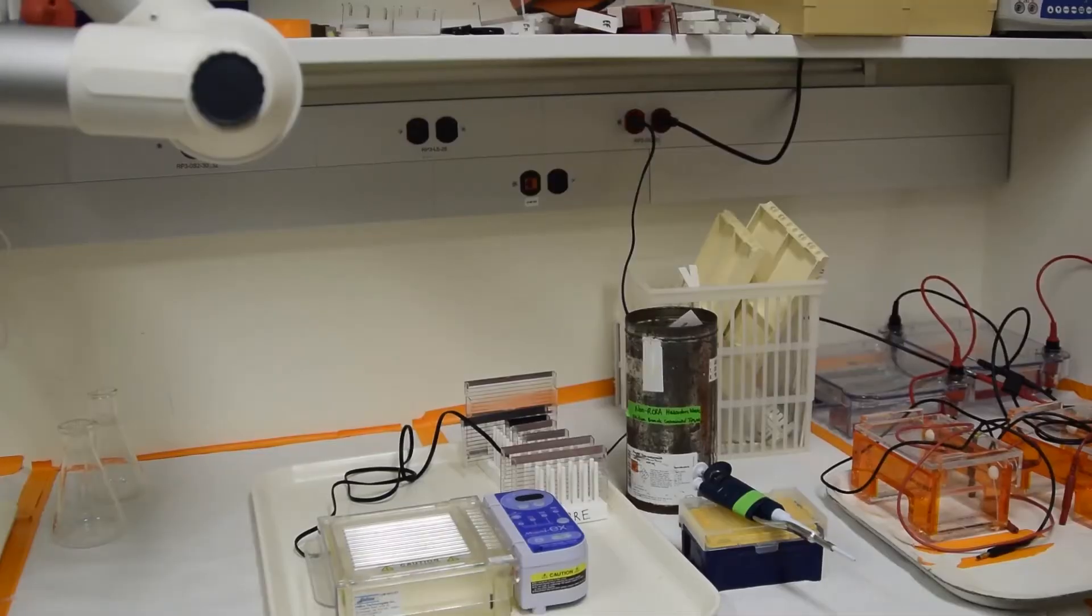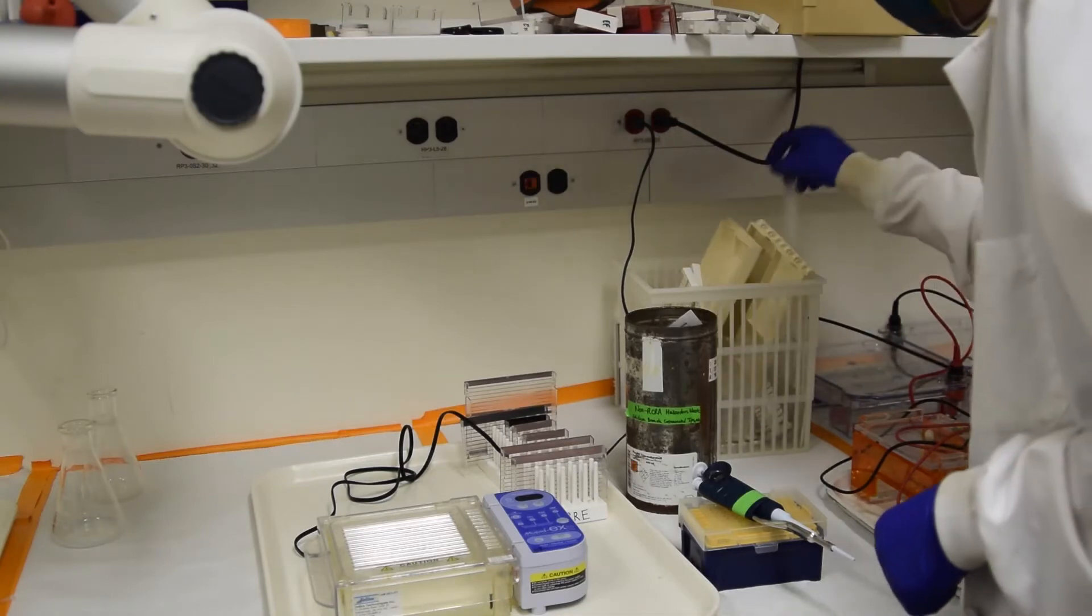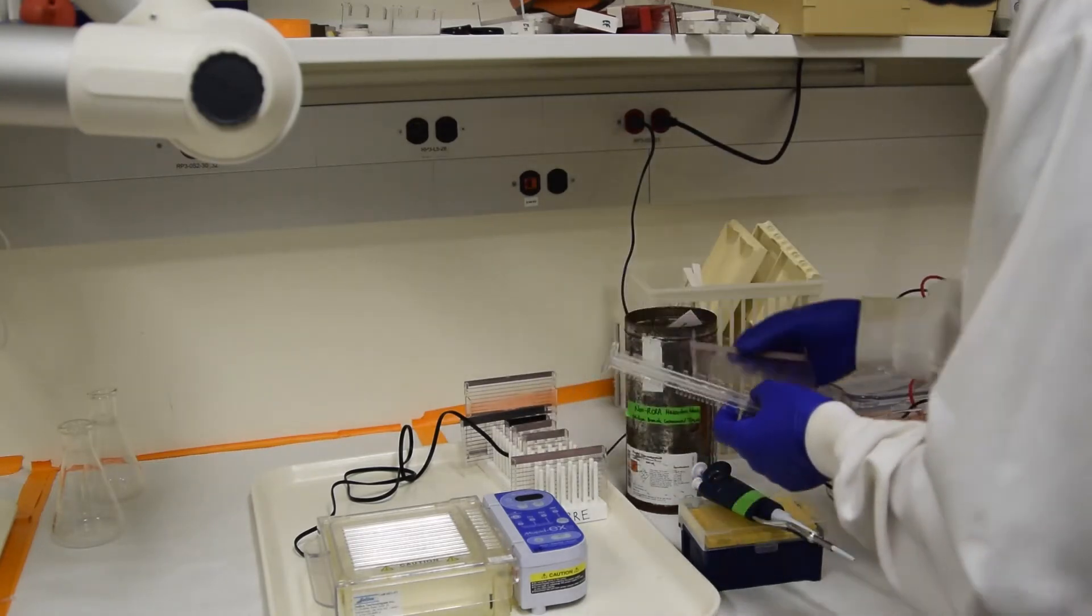Get out an appropriately sized gel tray. You can borrow them from other labs as long as you keep them in good shape. This one holds about 50 milliliters and has 20 wells.